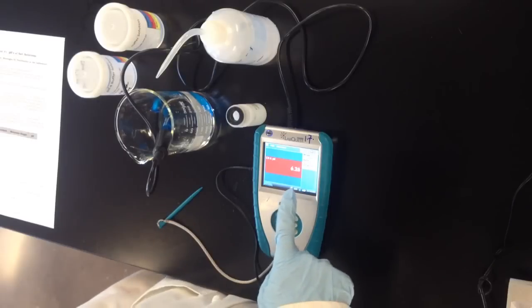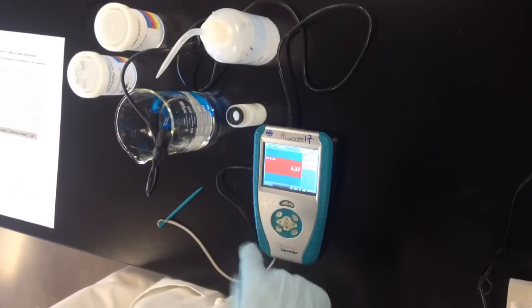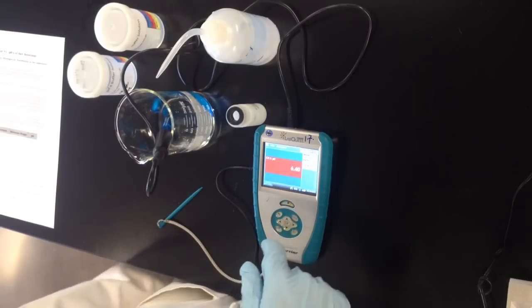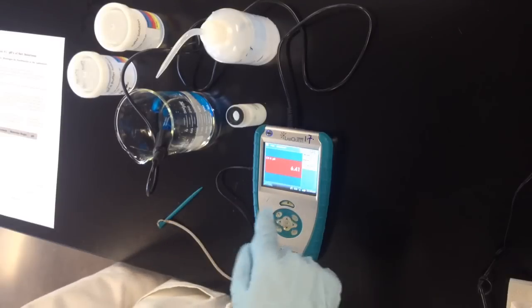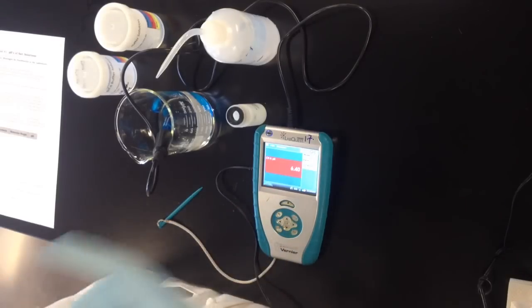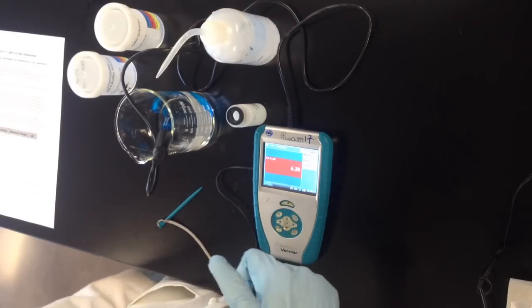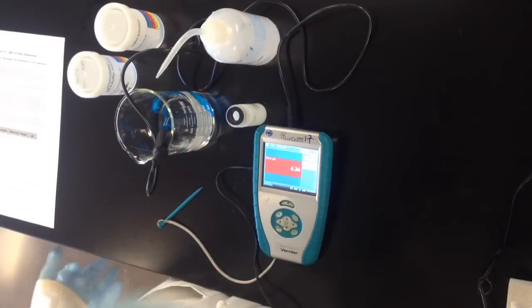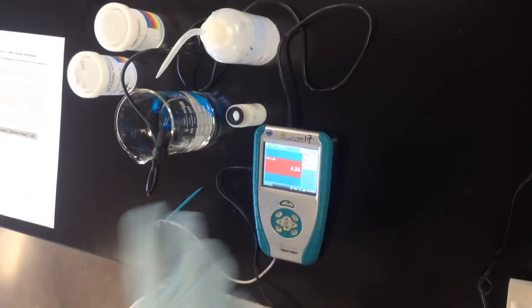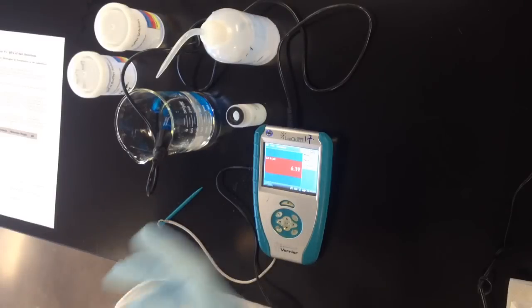Now you'll notice right away that the pH here will not necessarily be 7 and that's to be expected because the water is deionized and the pH electrode, which is an electrical device, depends on the presence of ions that can conduct electricity within the solution to give an accurate reading. So don't worry if this reading isn't exactly 7.00.